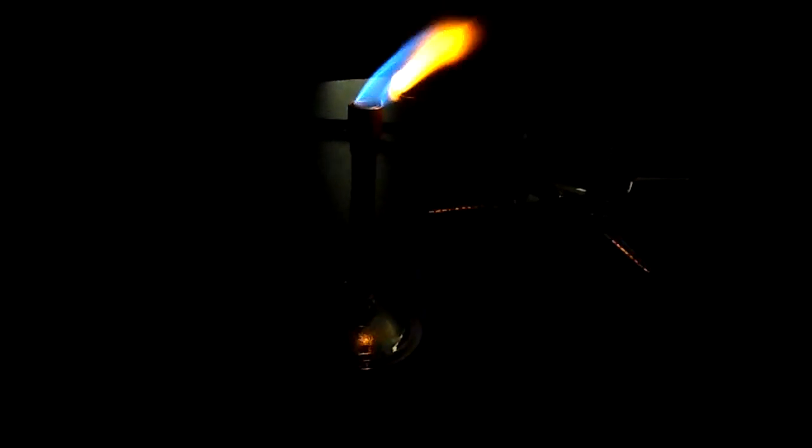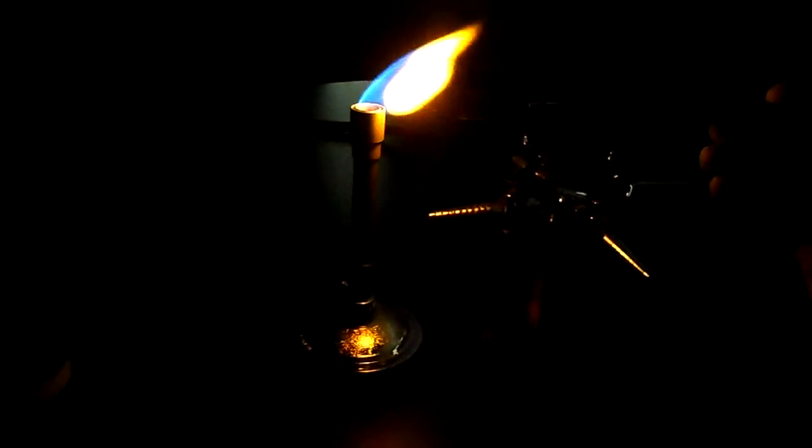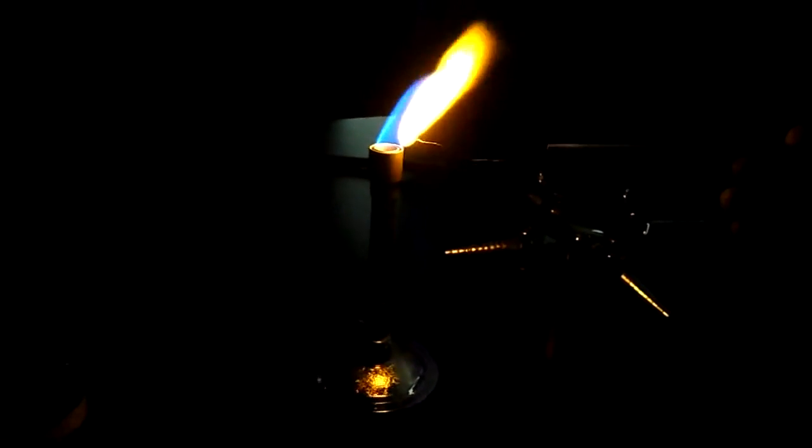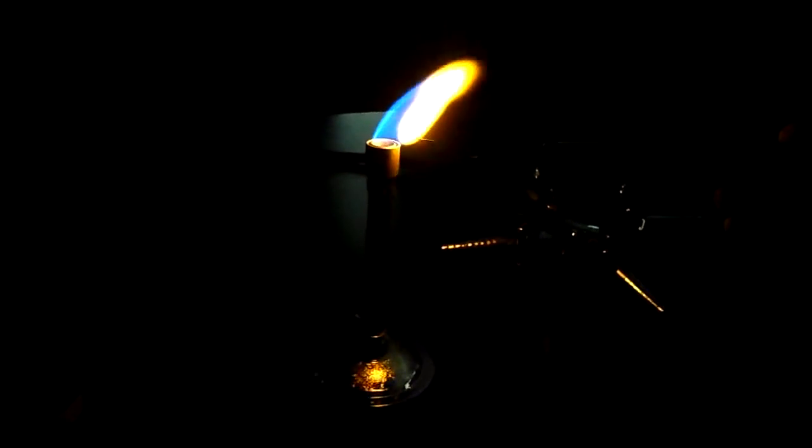Okay, make sure just the loop is in the flame. So now that that's clean, I'm going to place it into the sodium. Okay, and if you see where the loop is, sodium is showing an orange color. So you should be recording orange. Now I'm going to clean it.